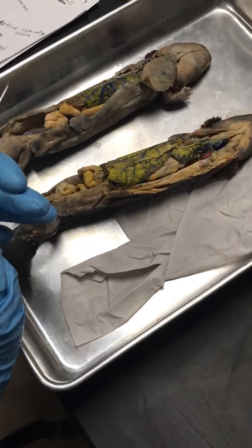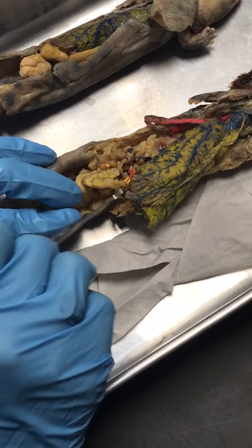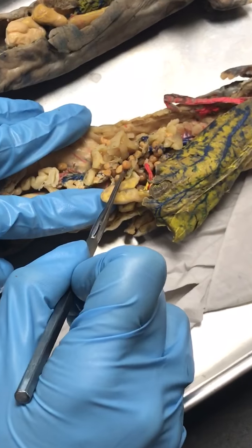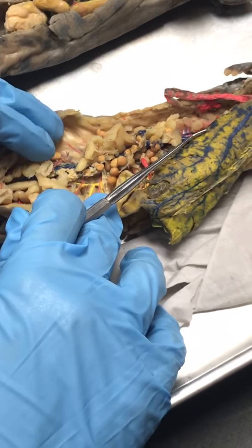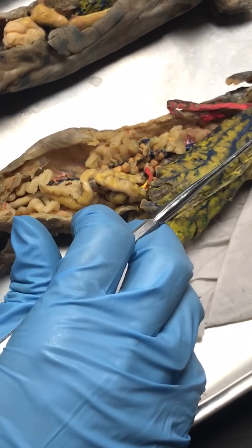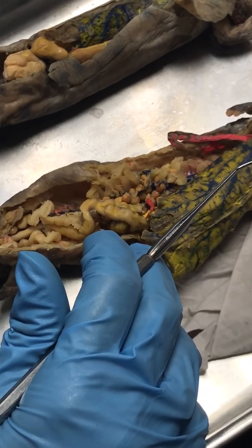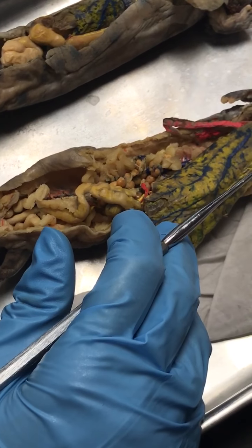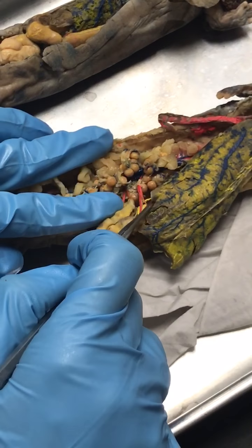Female. So I'm not going to go in the same order as the paper, but all these orangish spheres are ova that have, yeah, those are the popcorn. Team popcorn. That have exploded from the ovary. So just like in humans, when we ovulate, one egg explodes out of the ovary. But here we have a whole bunch.